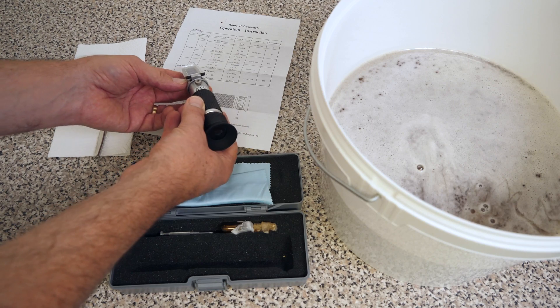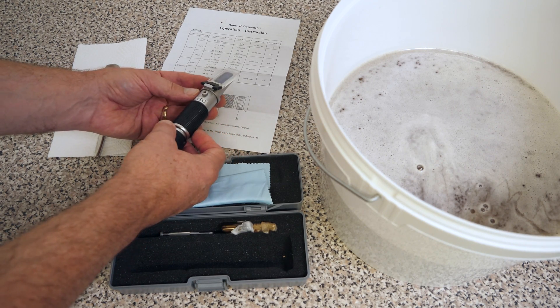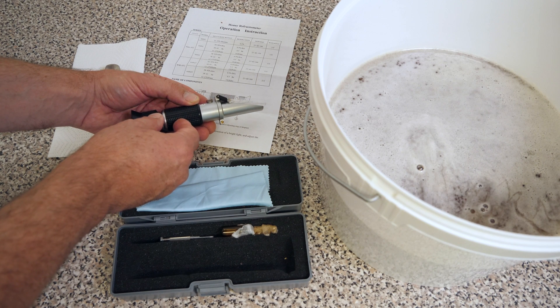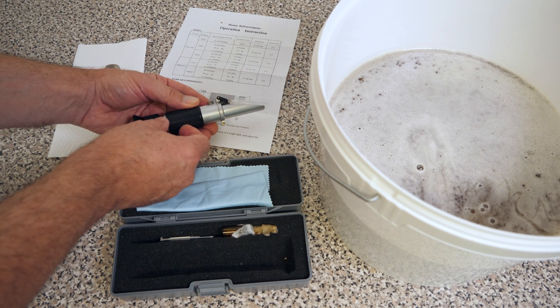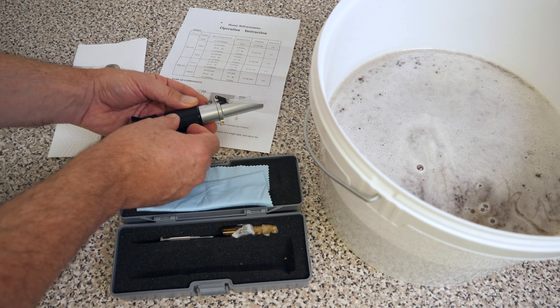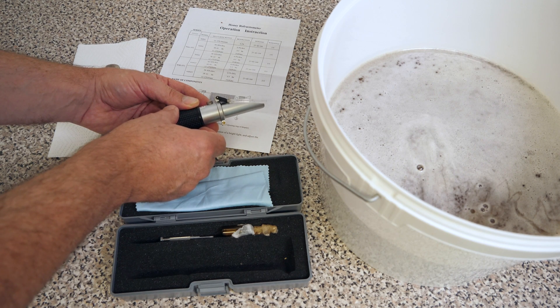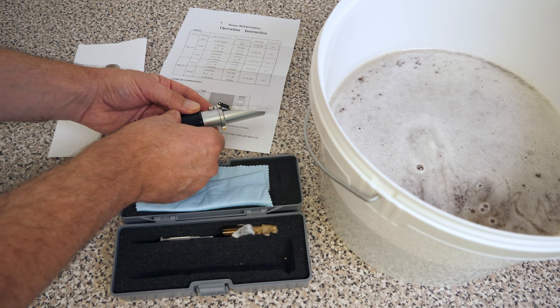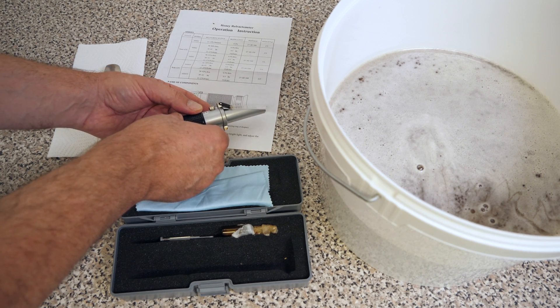It's really important that we check the percentage of water in our honey because we don't want it to have more than 20% water. Above that level, yeasts and molds can grow, and particularly with yeast, the honey will ferment in the jar, meaning it is then not usable.